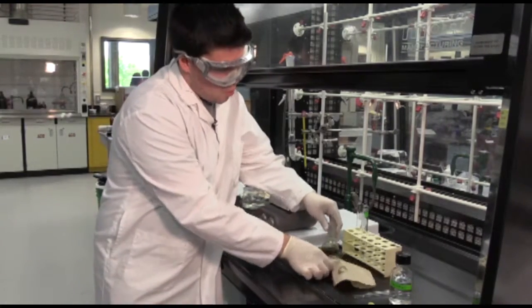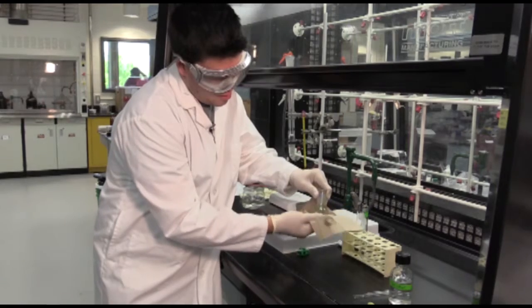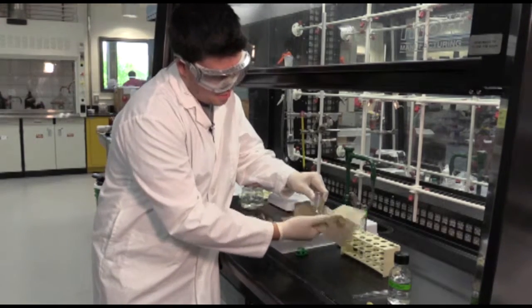It's important now that you wipe down your round bottom flask to remove any leftover oil.